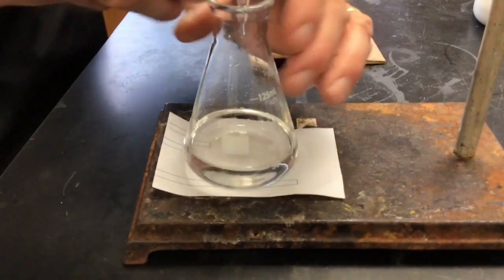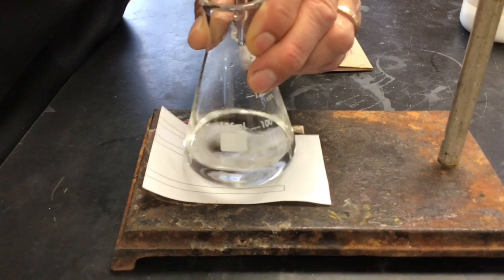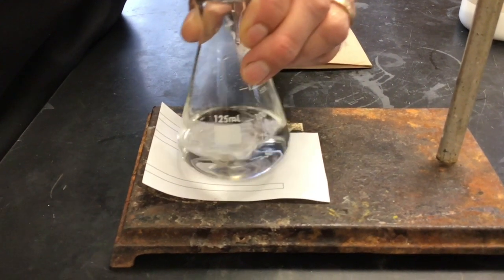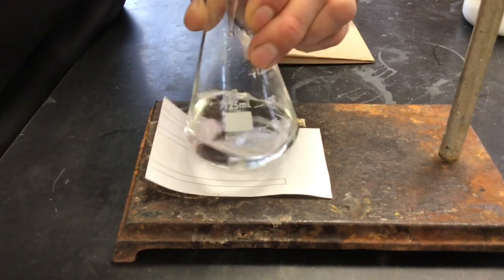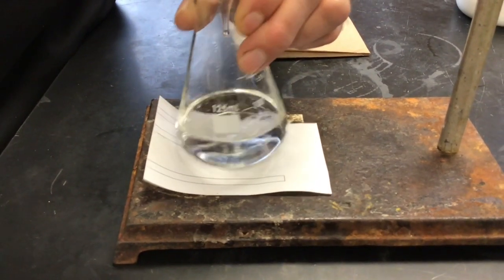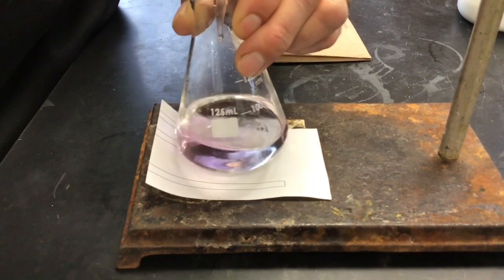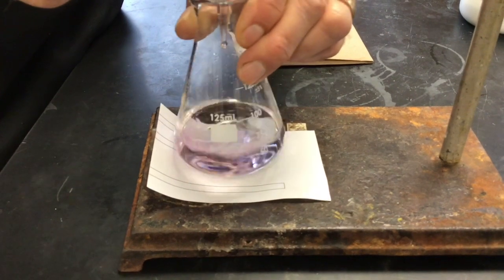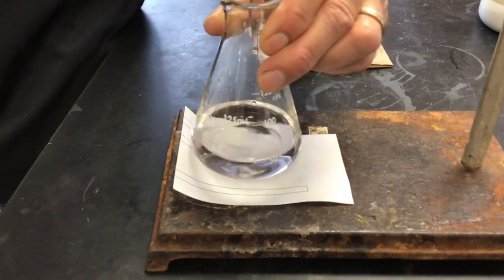Okay, let's see now if we can do a better job. I think it disappeared.